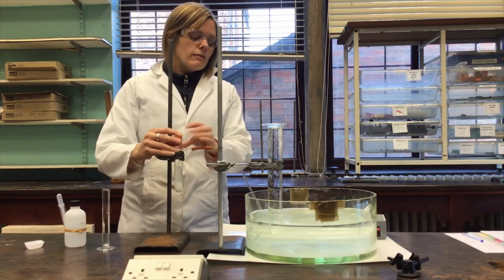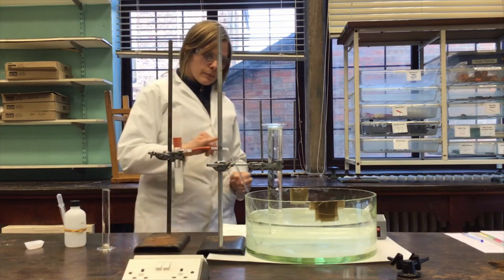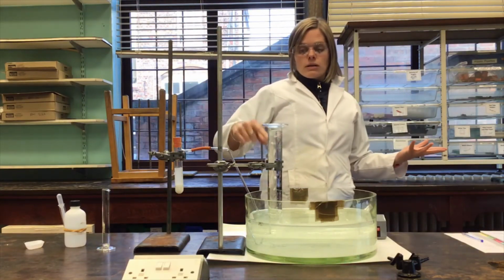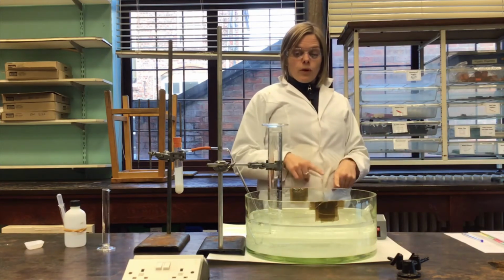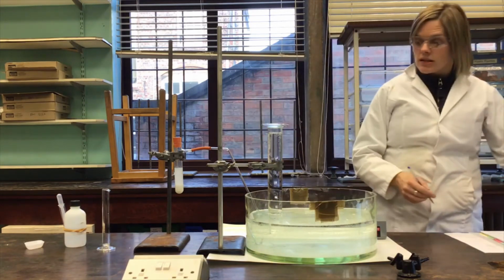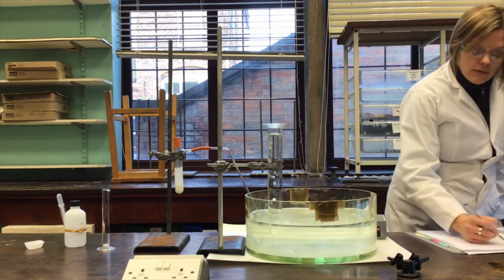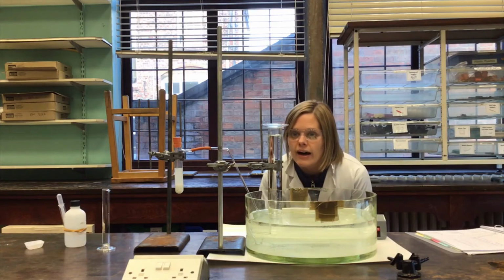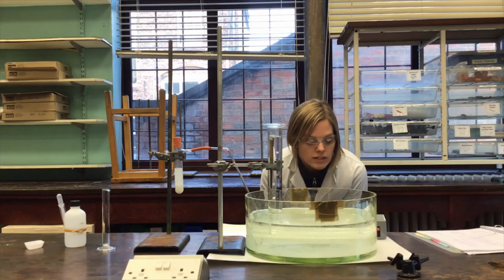Okay, so the next thing to notice is that this starts to bubble and the bubbles go straight into this measuring cylinder. Now at the moment it's a huge measuring cylinder and I need to wait until this reaches the scale. So I'm going to start the stopwatch at the point at which I can measure this accurately. So the first recording at time 0 is going to be at 26 centimetres cubed of gas collected. So I'm going to keep my eye on this now, and that's there. So that was time 0, the stopwatch is now going. Now I'm going to measure every 10 seconds.